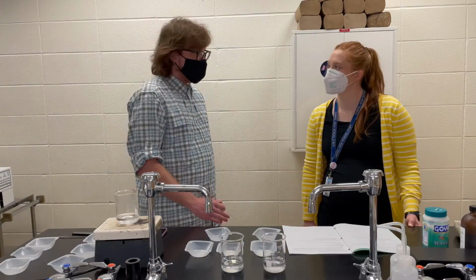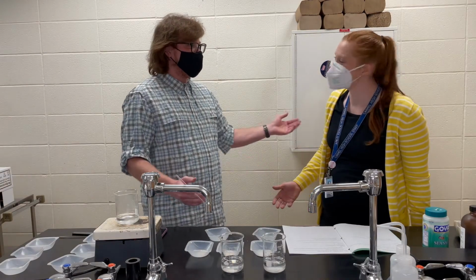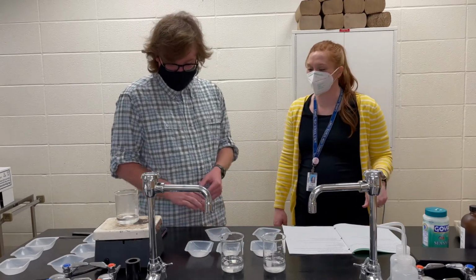Where are we gonna start, Mr. Sharkey? Well, now we're back with part two. We already did part one earlier in the video, right? So, part two, we're gonna look at whether or not stirring has an effect on the rate of solubility.